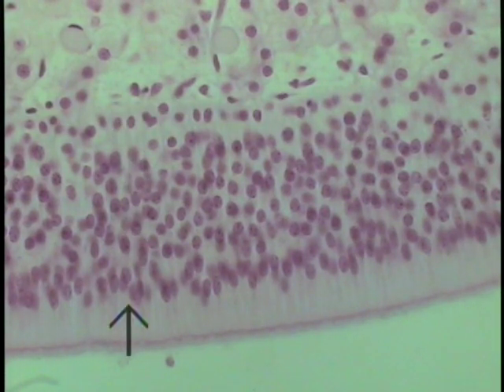The other two cell types are a sustentacular or supporting cell, and then a typical olfactory bipolar neuron, an actual neuron whose apices will reach the surface, whose cell body lies within the epithelium that isn't demarcated or completely visible.